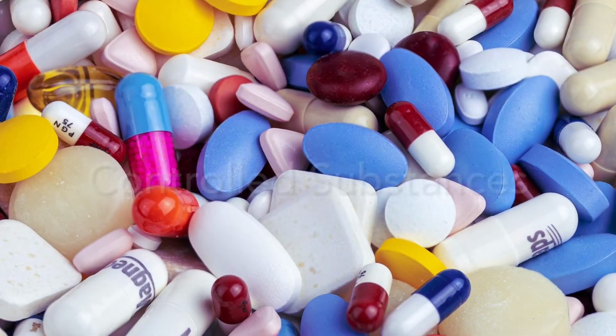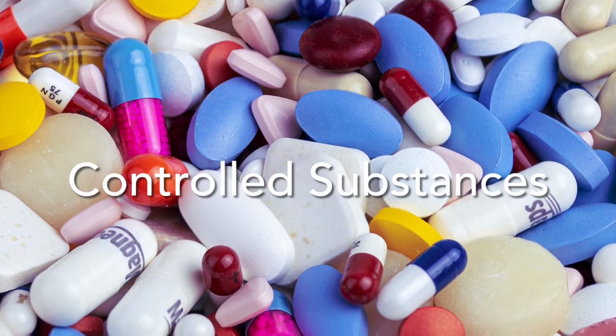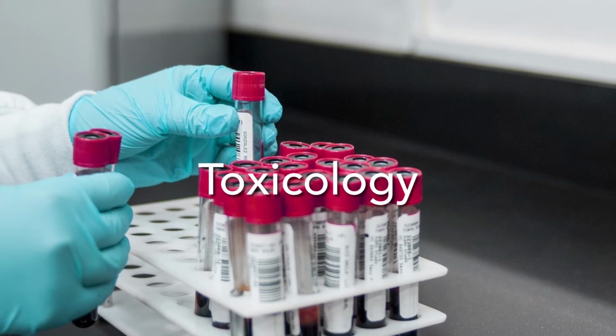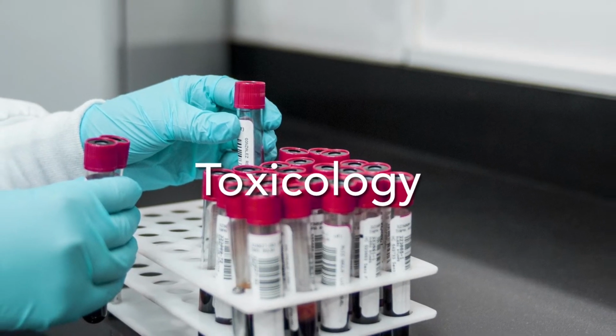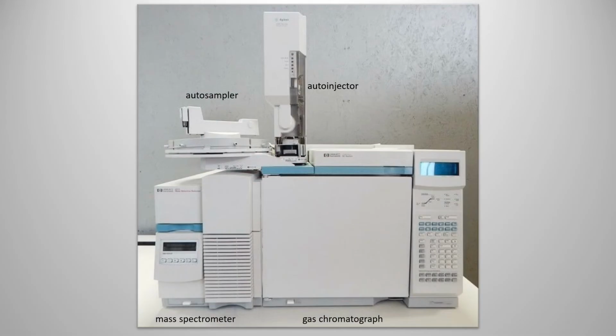It's also used to analyze evidence to identify whether it contains a controlled substance and to identify and determine the concentration of alcohol and controlled substances in body fluids. This is an image of the Gas Chromatograph Mass Spectrometer.